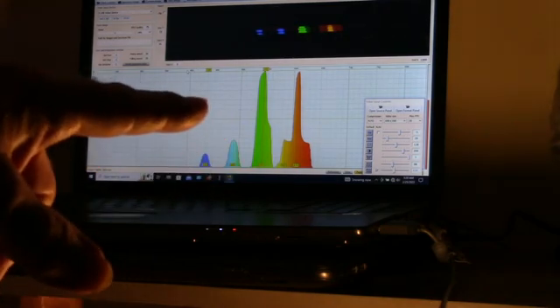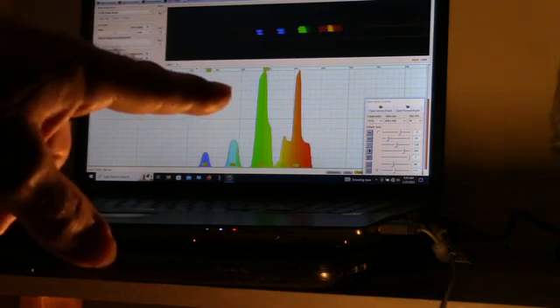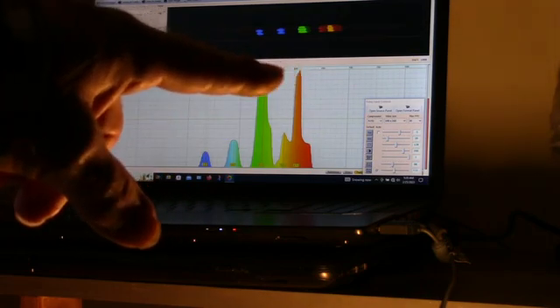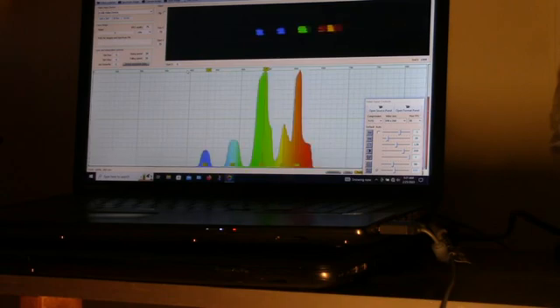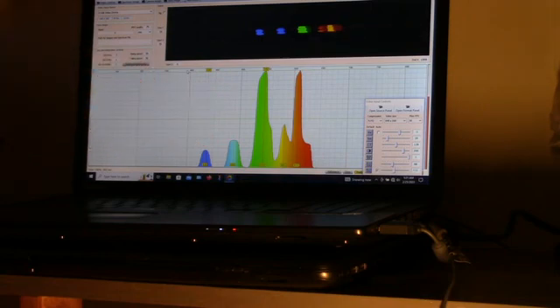Okay, if you look on the display here, you can see the two calibration points that I'm using to calibrate this apparatus. The two spectrum lines of mercury, which are in this lamp, are here, and they are at 436 and 546 nanometers. Here you can see the response time. There's a little bit of a lag due to the latency in the computer. So, 436 and 546, using a compact fluorescent lamp to calibrate the software here.